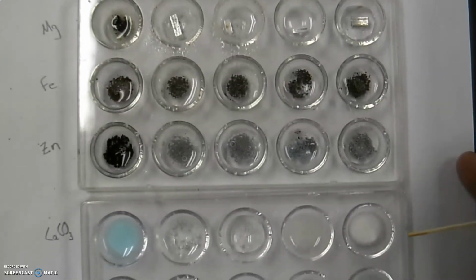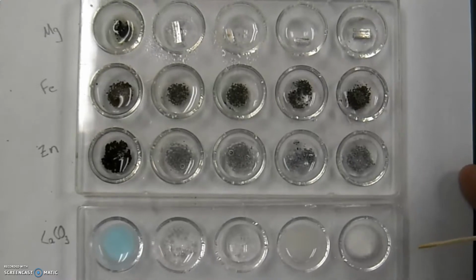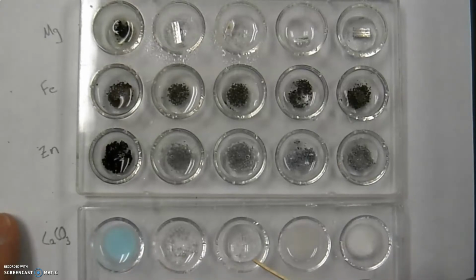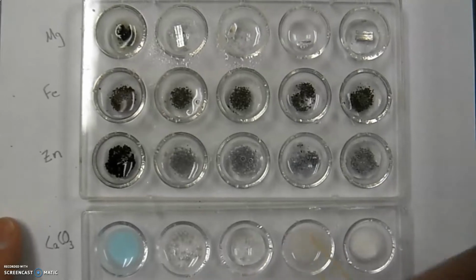And I don't know if you could actually see this one. It looks like it might have been off camera when we were doing it, but I'll bring that up. The calcium carbonate down here. So this one again, they're all white powder, but as far as how they reacted was a bit different. These three, definitely you see a significant change. This one's just gone, so is this one. This one is on its way to being gone.